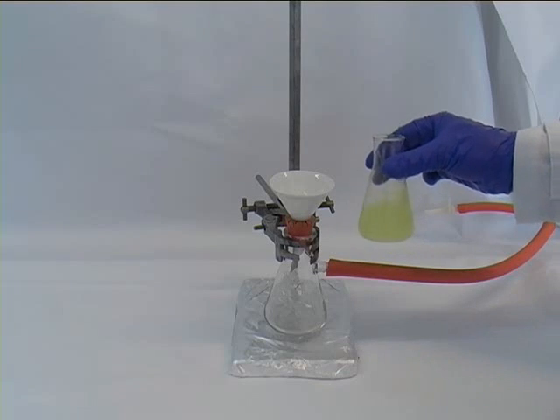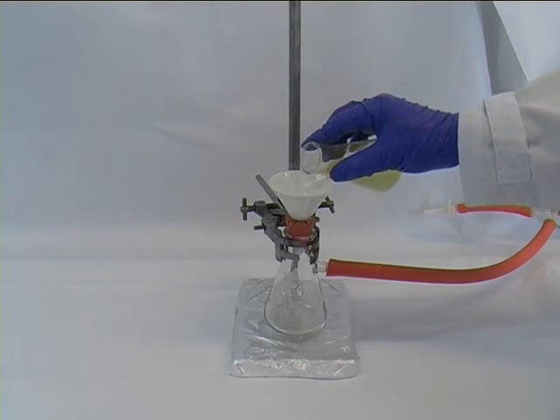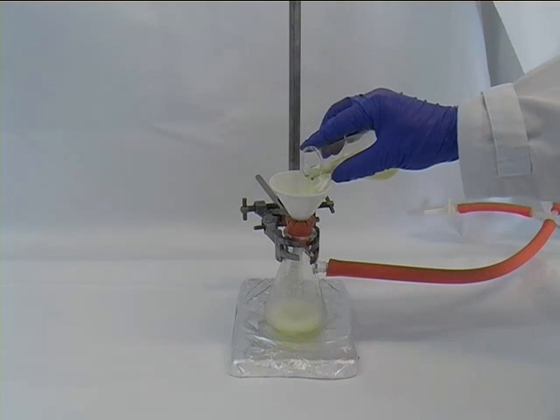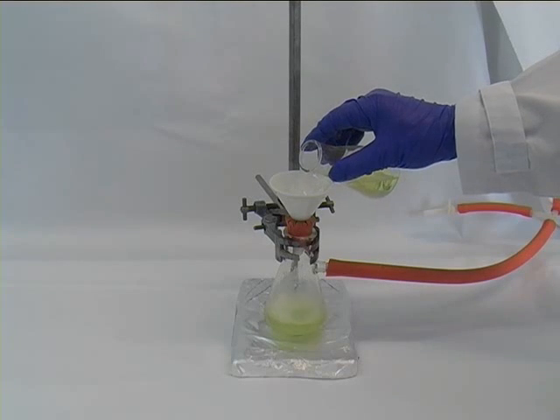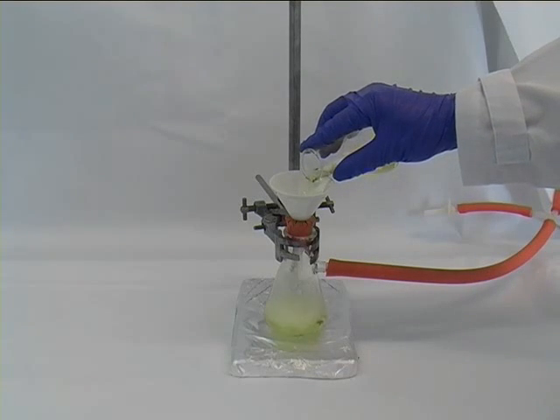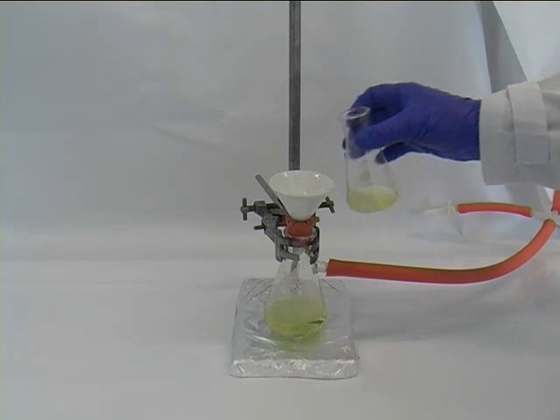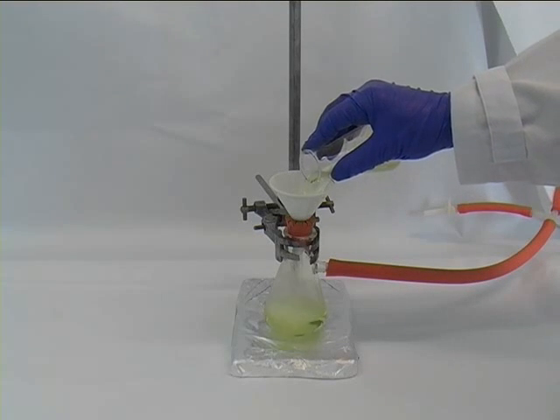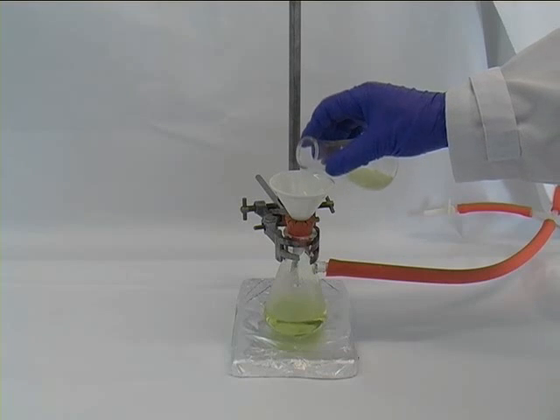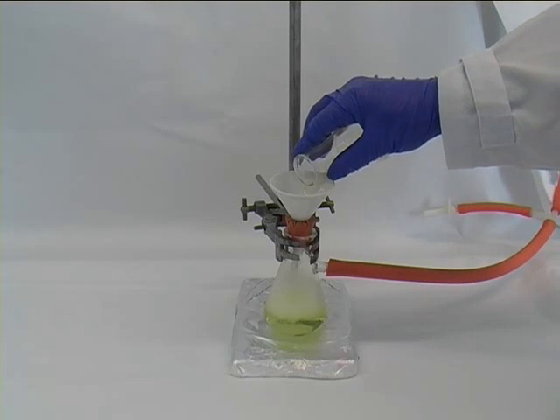You might want to shake it up a little bit. In this way the filter gets quickly weighed down by the magnesium sulphate. When you do the filtration, make sure that none of the liquid or the foam above the liquid gets sucked into the vacuum tubing, so filter it in a couple of portions until all the suspension is through.